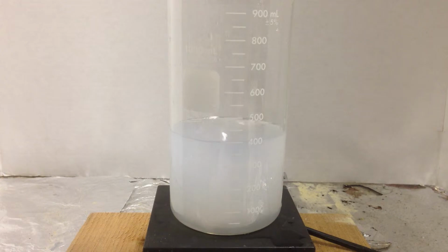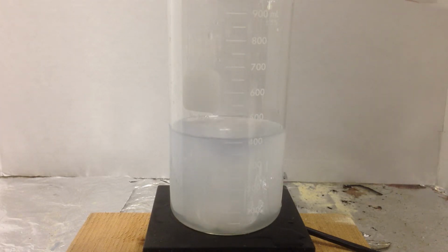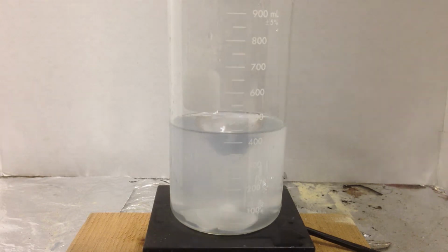Now, it's a weak base, it's an insoluble base, like magnesium hydroxide, which is usually insoluble. Okay, so with a strong acid, I could try to dissolve this. All right, I should be able to add some acid. As you can see, it should dissolve it. Now, why did it get dissolved? We're getting a little clearer.